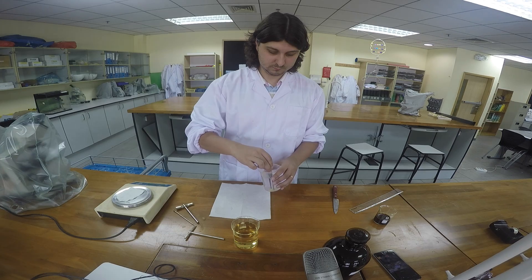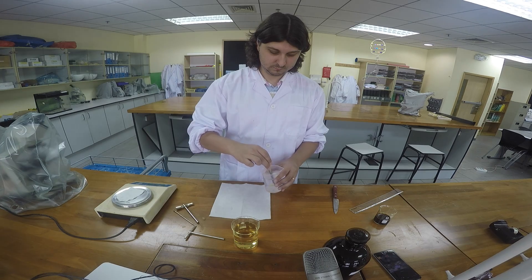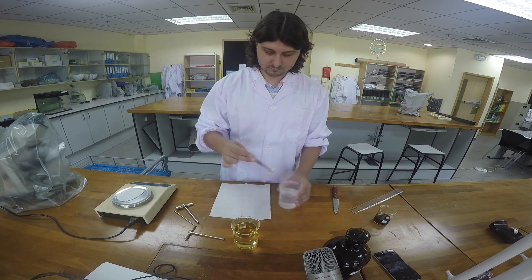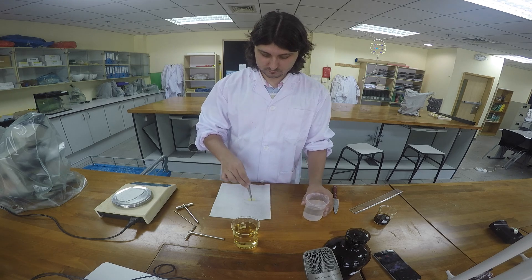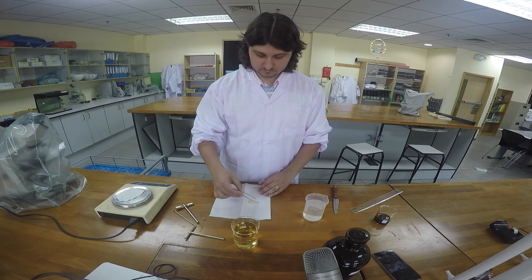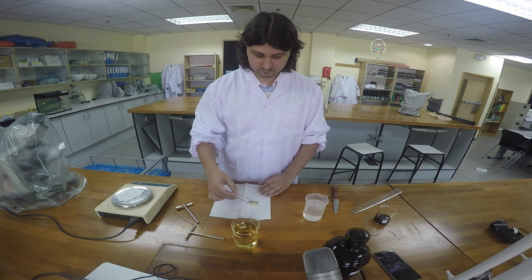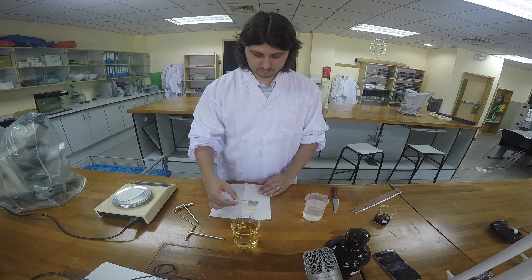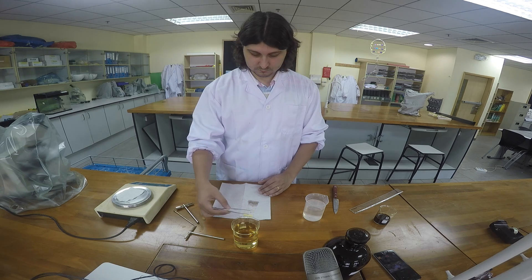Add the potato to a solution of known concentration for no less than 15 minutes. I'm using distilled water, so the concentration of NaCl or sucrose would be 0 grams per milliliter or 0%.